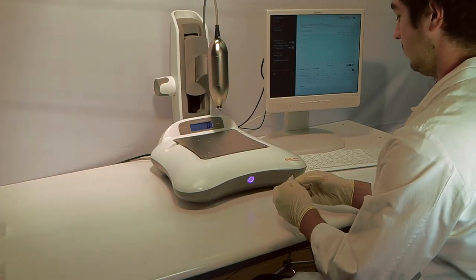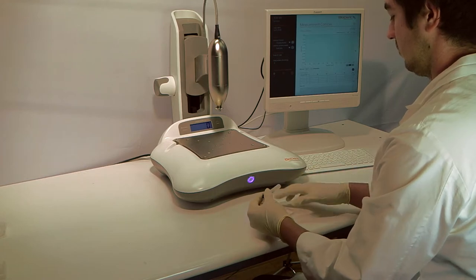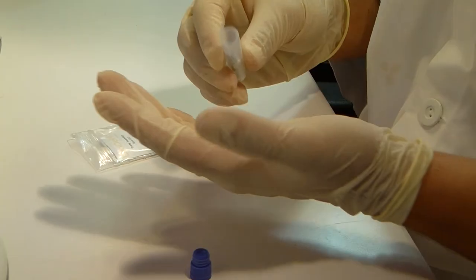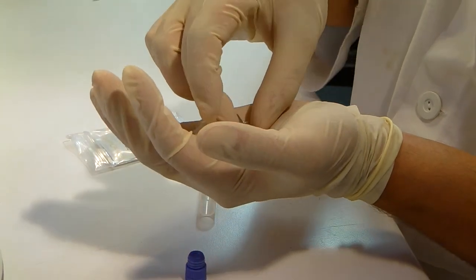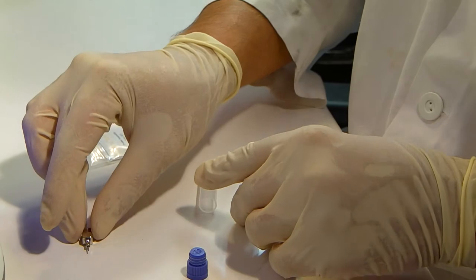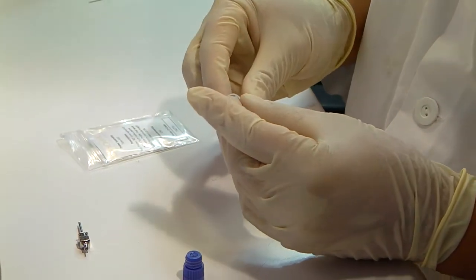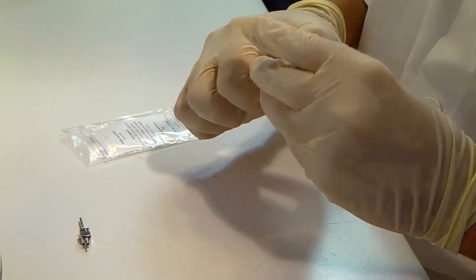First, carefully unpack the probe assembly. When removing the protective foam piece, be sure to hold the assembly upright to prevent the test probe from falling out of the reference probe. Store the foam piece inside the probe container and keep the container and ID code in a safe location.